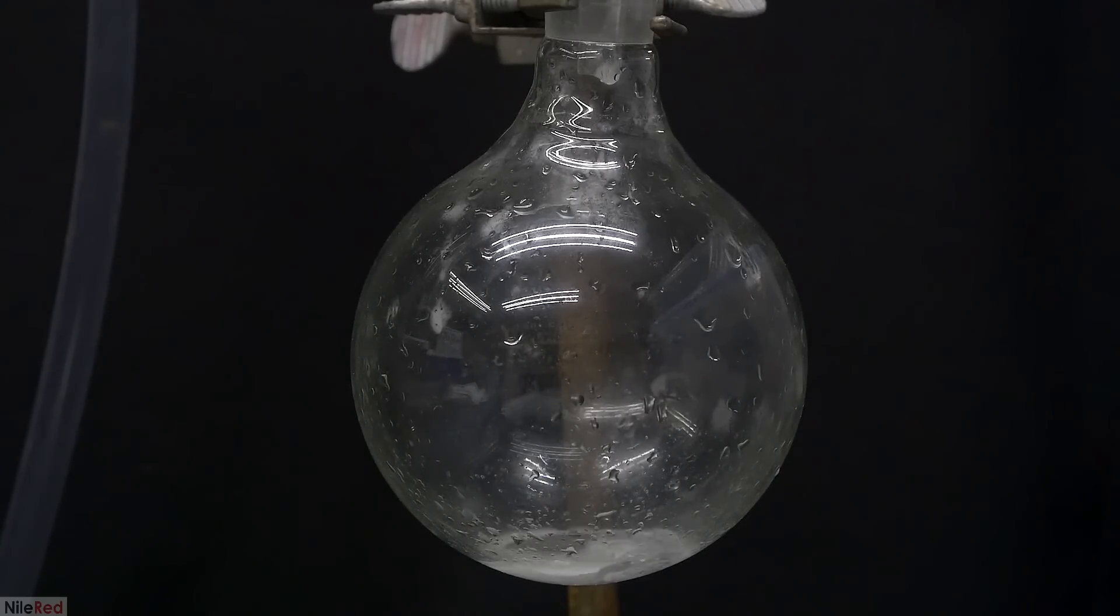This means that as long as our distillate is white, it means that oil is present and that we have to keep distilling. When there's no oil left, we should only be passing over crystal clear water and the distillation is done.